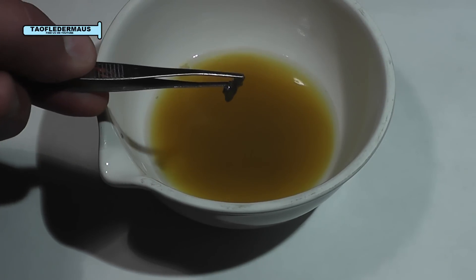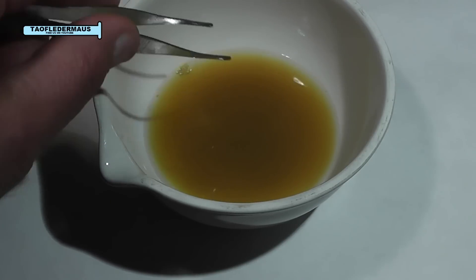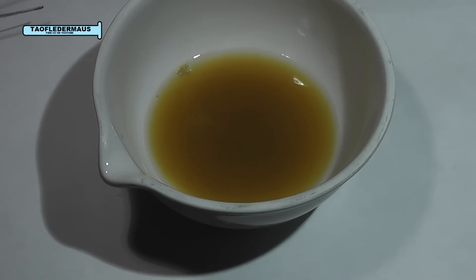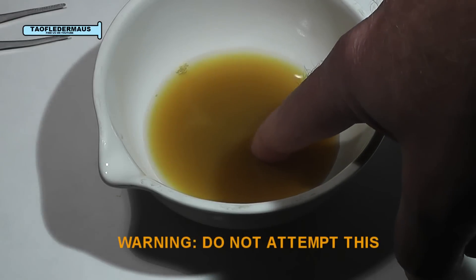And it's just a little shard that's left. Nitric acid will attack and dissolve a lot of minerals and ferrous metals, but not stainless steel and of course not the porcelain bowl. So yes, acid can dissolve a 400 million year old fossil.